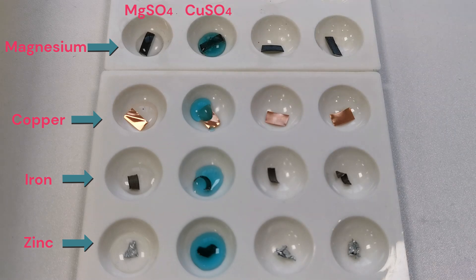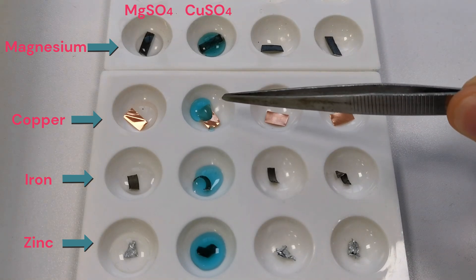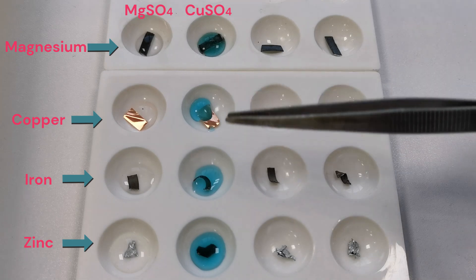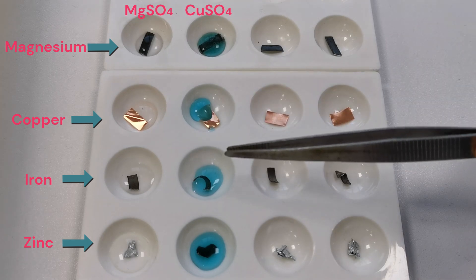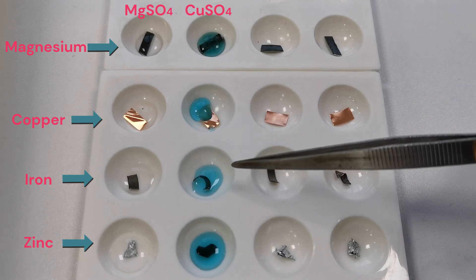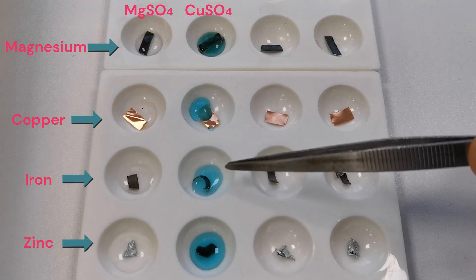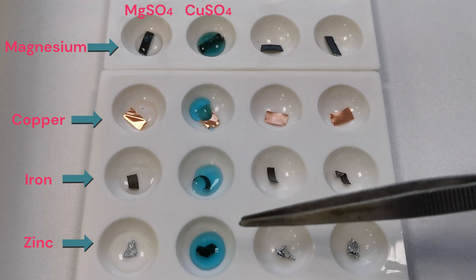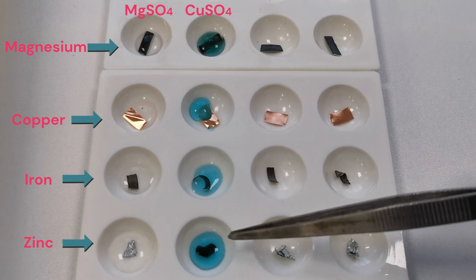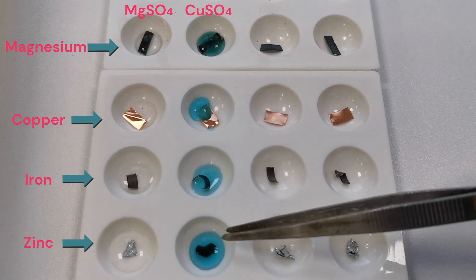There's lots of fizzing and bubbling. The copper is not reacting with copper sulfate, but the iron is reacting with the copper sulfate — I can see a few bubbles, though it's happening very slowly. You can also see that the zinc has reacted with the copper sulfate because the zinc has discolored.